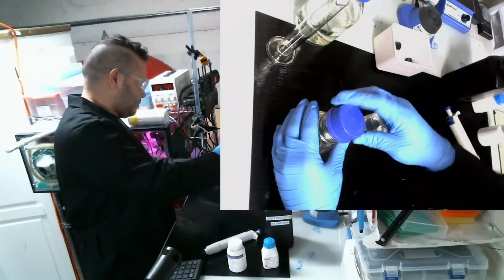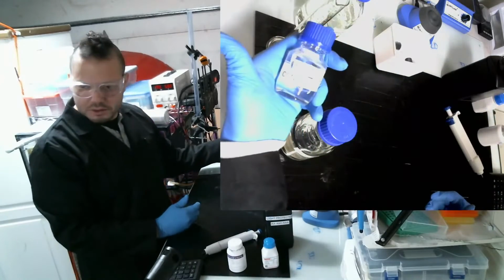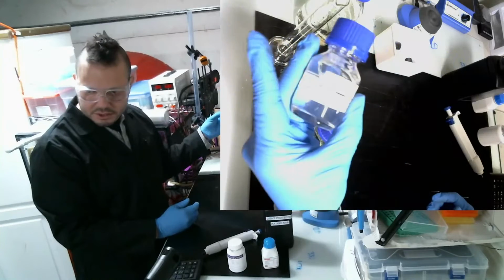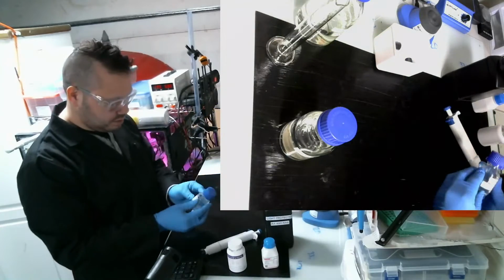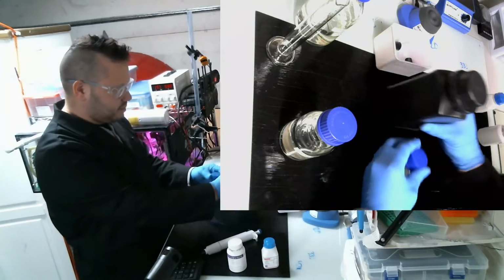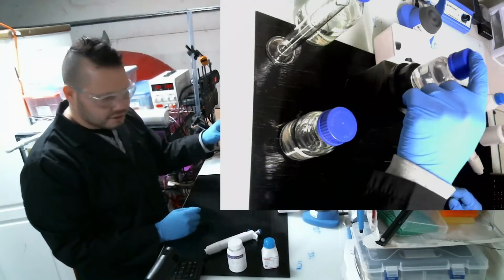Then I'm going to top that up, and I'm going to mix it around. For this control solution, it's a hormone control solution. It doesn't mean that it controls the hormones. It's essentially my control solution, and it mimics the solutions that are in this bottle minus the hormones.